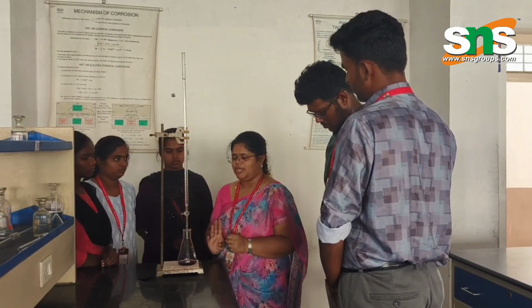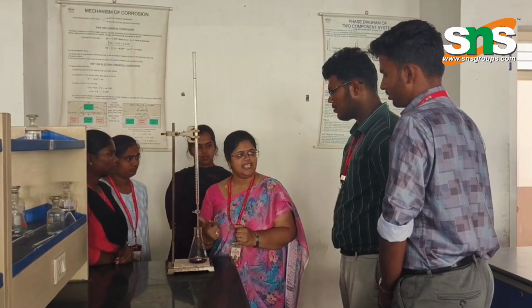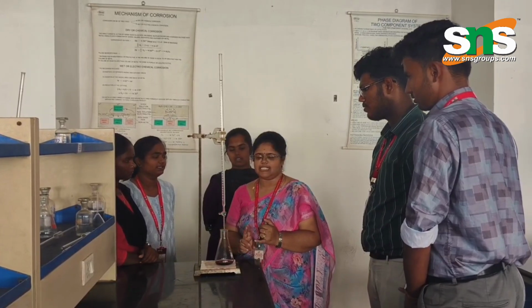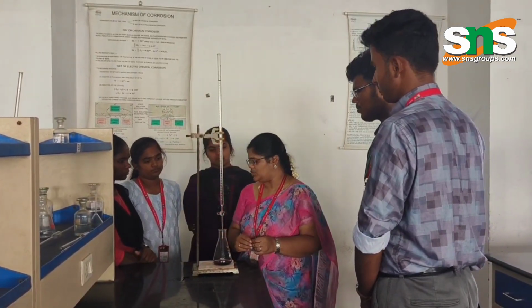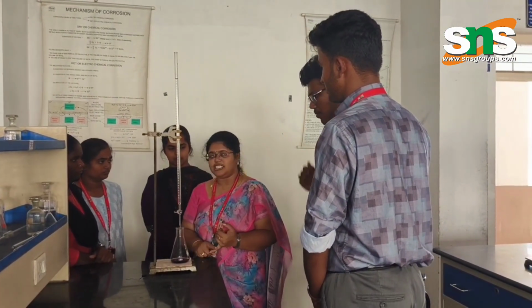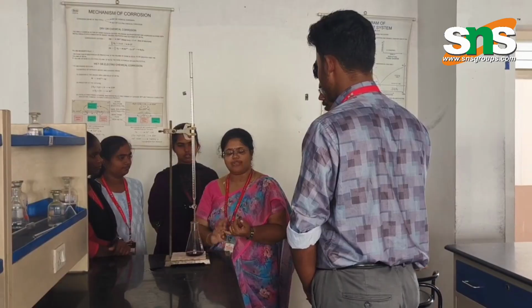Now we are going to estimate the total hardness by the EDTA method. EDTA is nothing but ethylene diamine tetraacetic acid. Now we have the EDTA solution in the burette, and I have put 20 ml of standard hard water in the flask. What is the first titration? Standardization of EDTA.